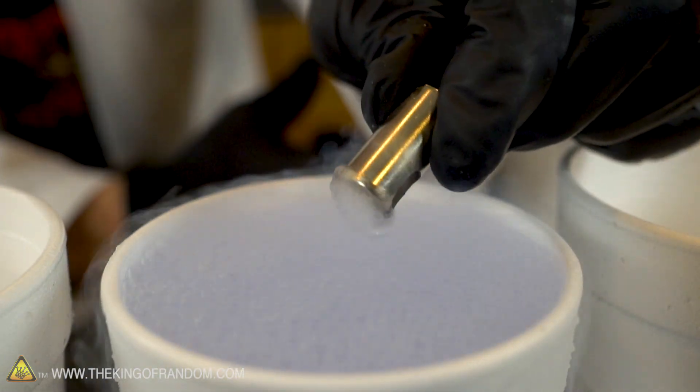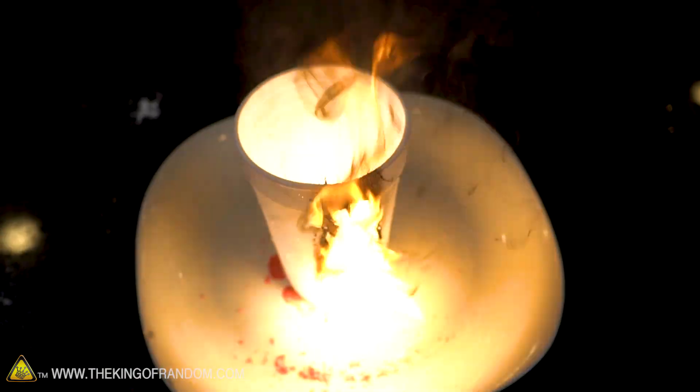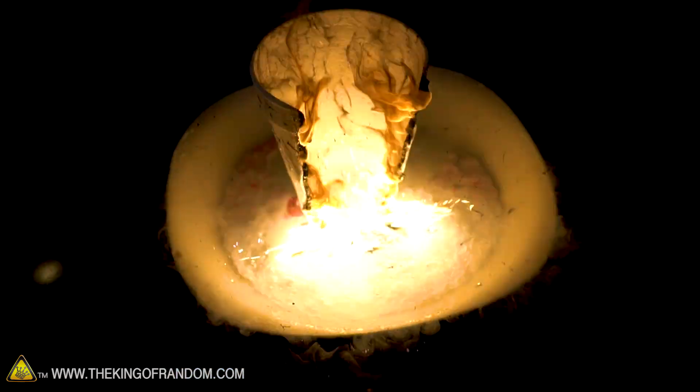Which apparently is paramagnetic. Just keep in mind that liquid oxygen can be very very dangerous stuff, and if it catches anything on fire it can make a terrible mess. Thanks for joining me for this experiment guys - I'll be looking for you in the next one. Talk to you then.